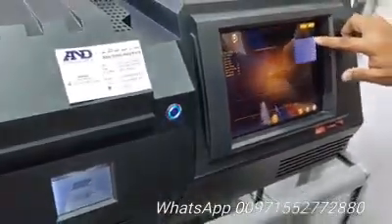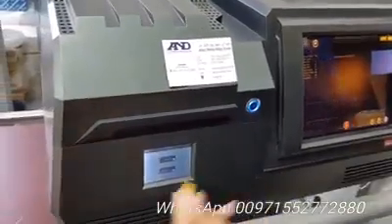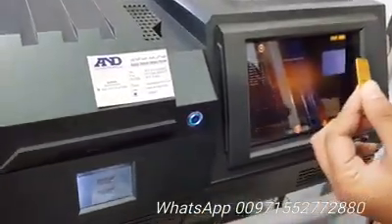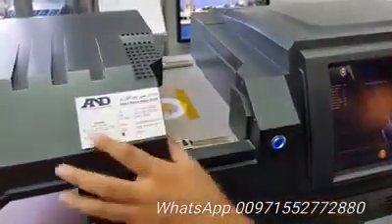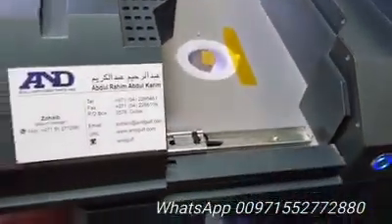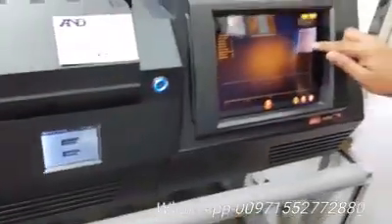This is the gold, and this is the screen basically. It will tell you from which point you are testing your gold. We have this 24 karat pure 999 sample. We have to keep it here — we have enough room to keep your gold. Just close it off. From here we know from which area we are testing this sample.